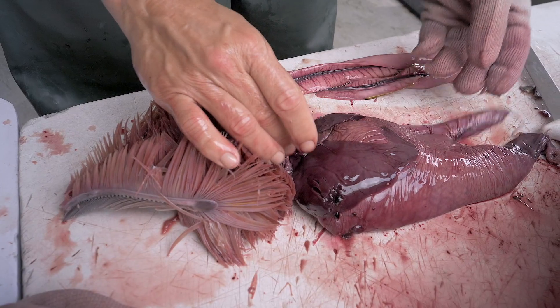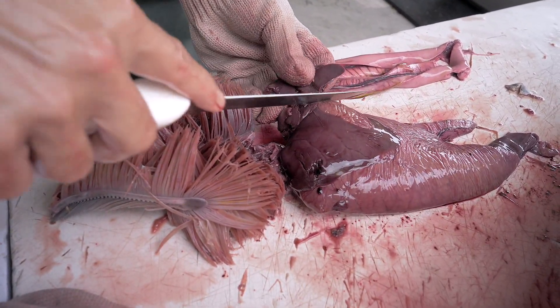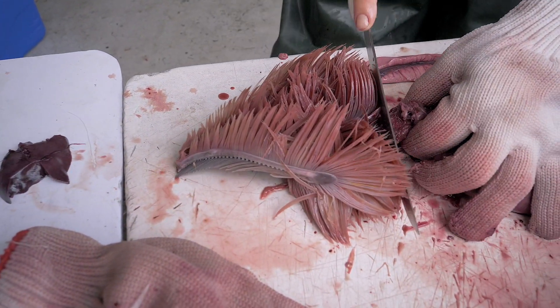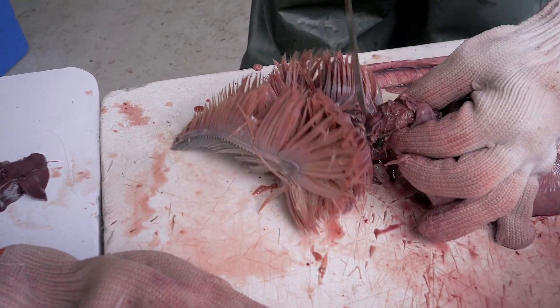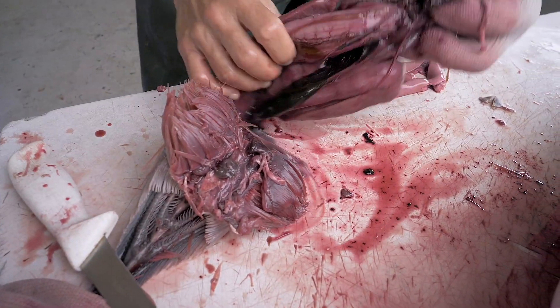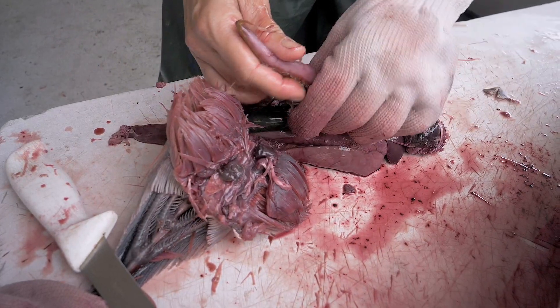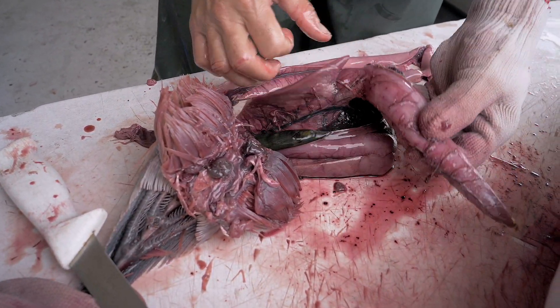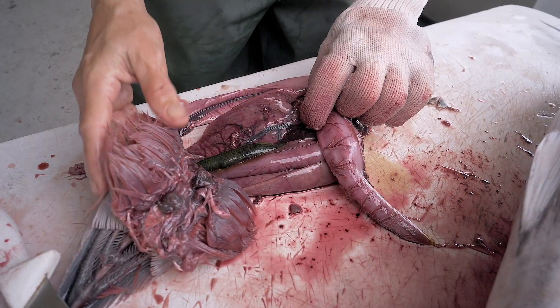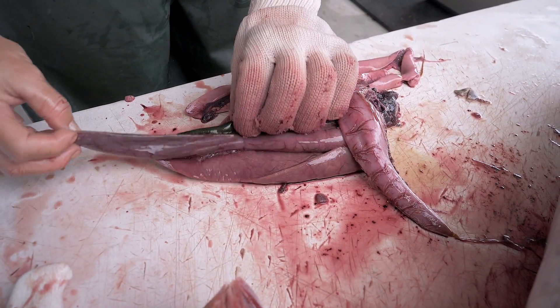To collect the samples now, collect a section of liver. Cut the stomach as close as possible to the gills. Be careful the prey don't come out of the esophagus. If they do, just push them back inside. If you can't because they are too small, place them inside the plastic bag with the stomach, and don't lose anything. If the stomach is really full, just use a piece of rope to close the stomach.